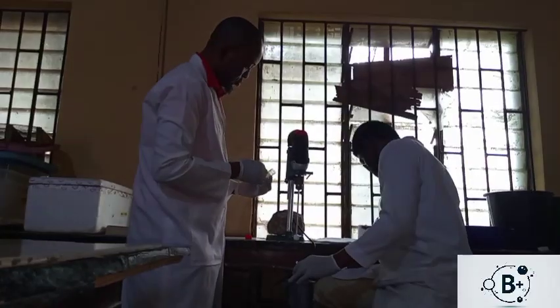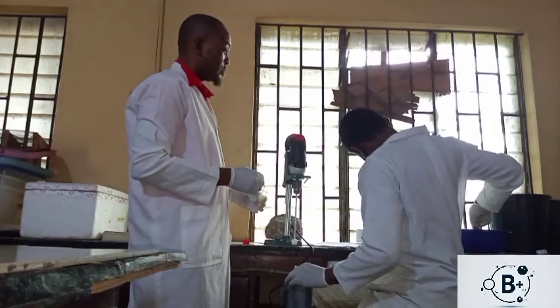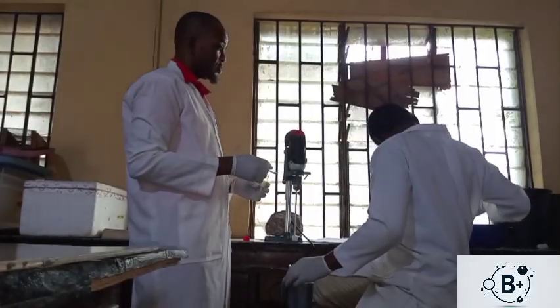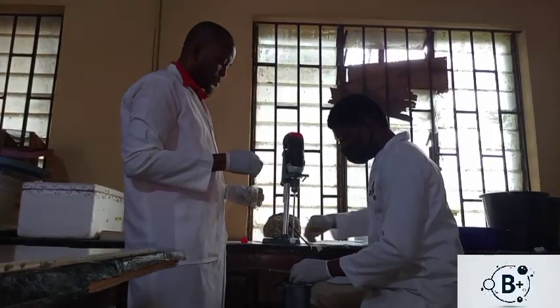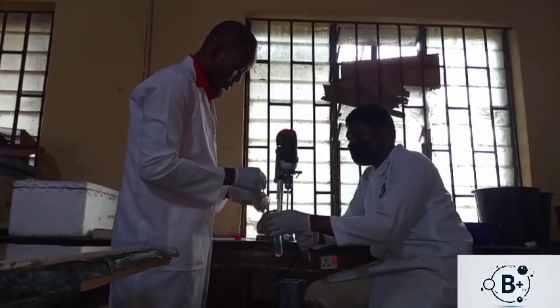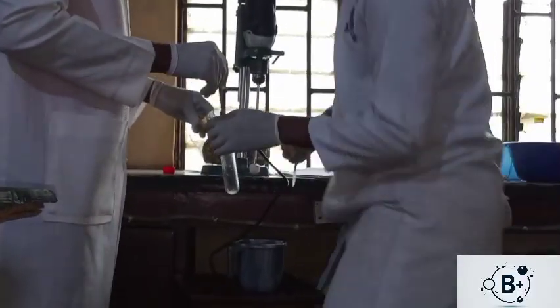So 6BLK, 6BLKT. This is for group 6. So we transfer the tissue here.